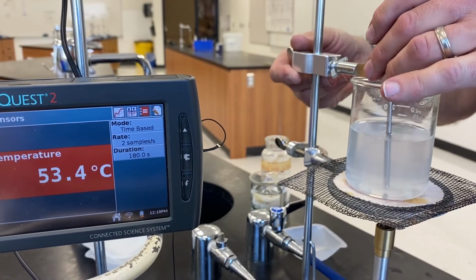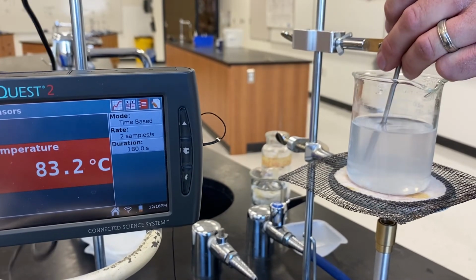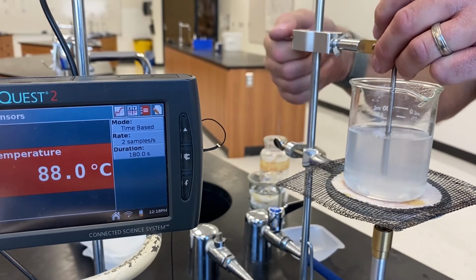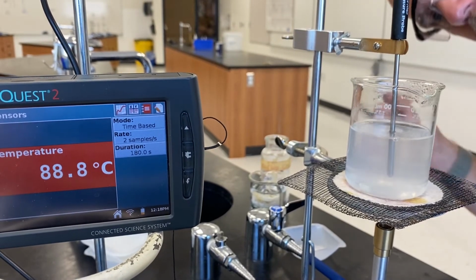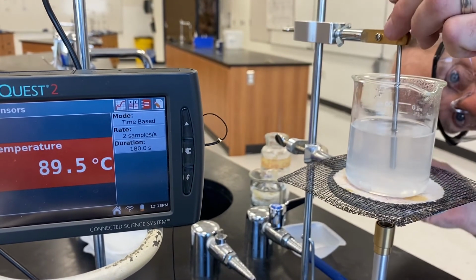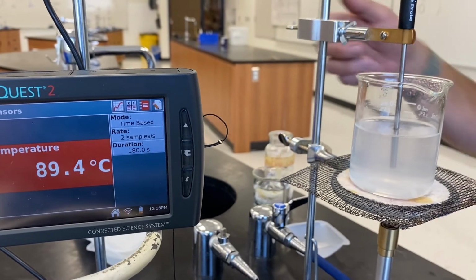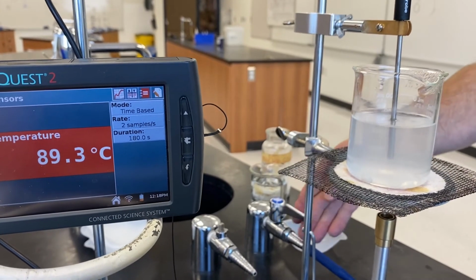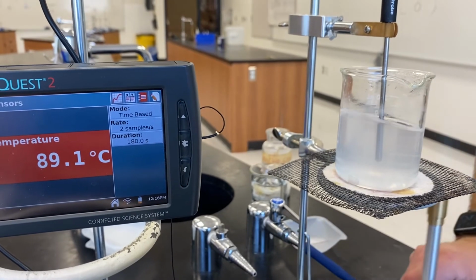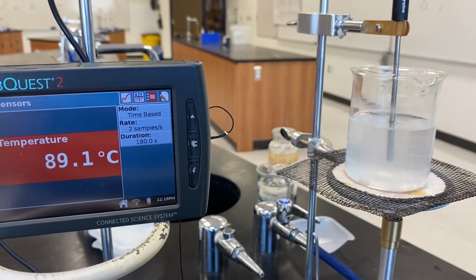Wow. Holy smokes. Those cords are not terribly convenient. All right. Yeah. Well, maybe a little hotter. Okay. Like so. Get this burner going. Boom. What are we at? 89.1. Alright.